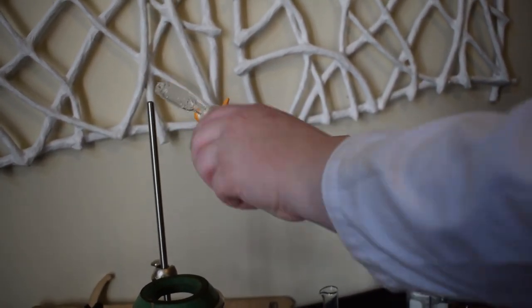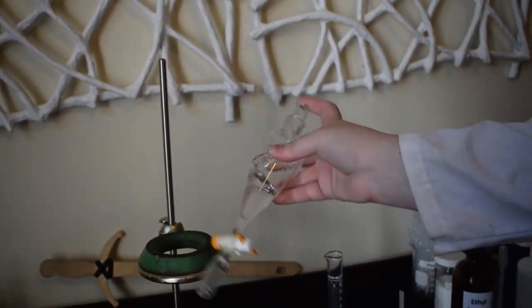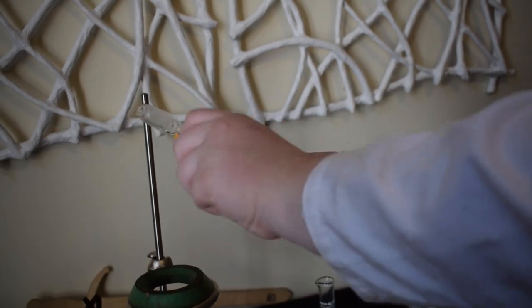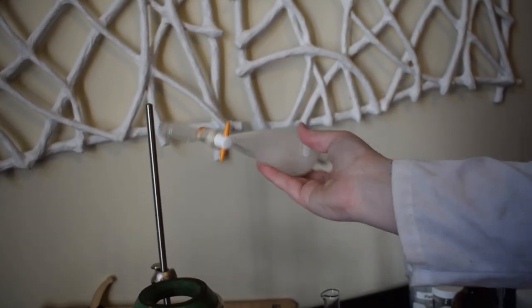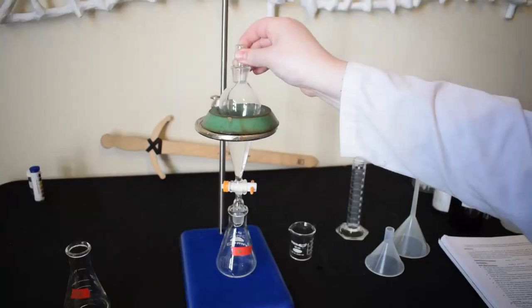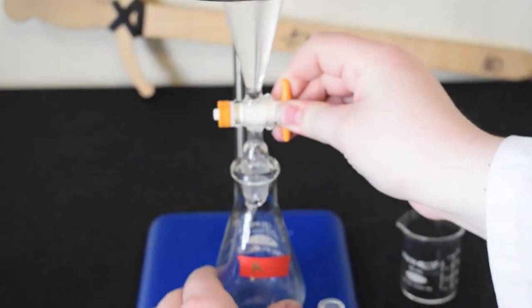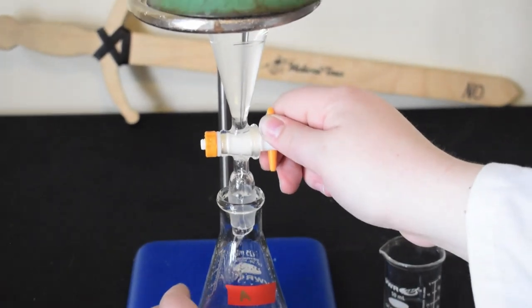We are repeating the shaking and venting process as before. And we are going to drain the bottom layer into the aqueous flask.